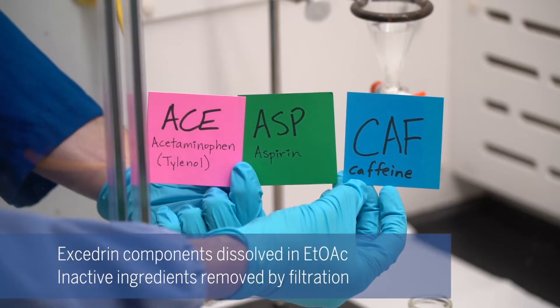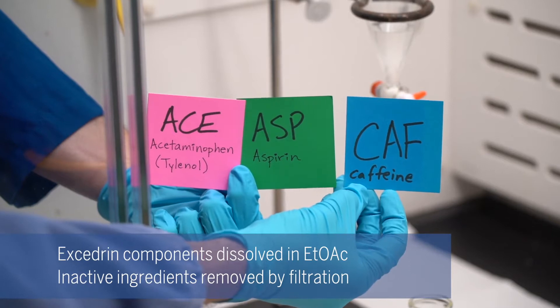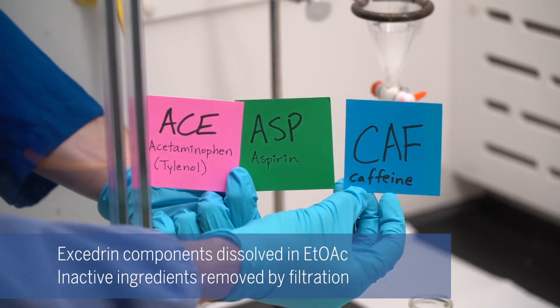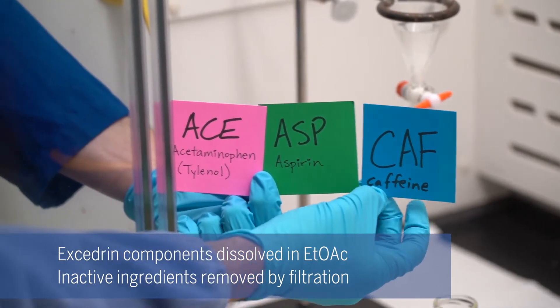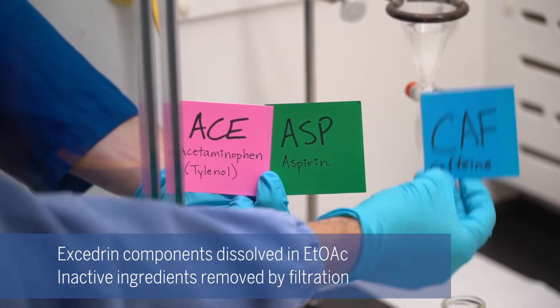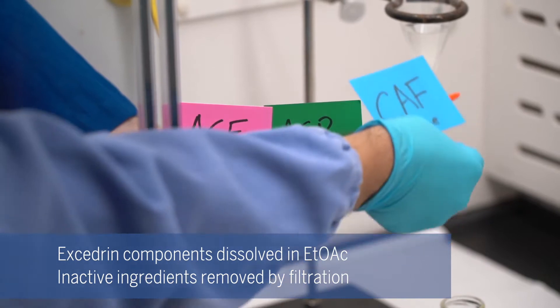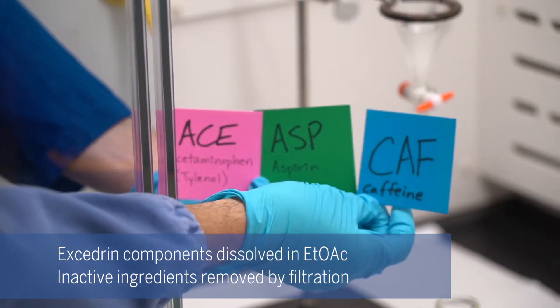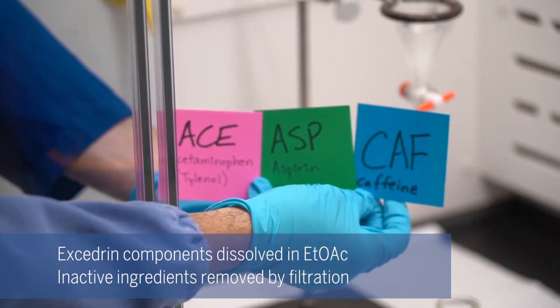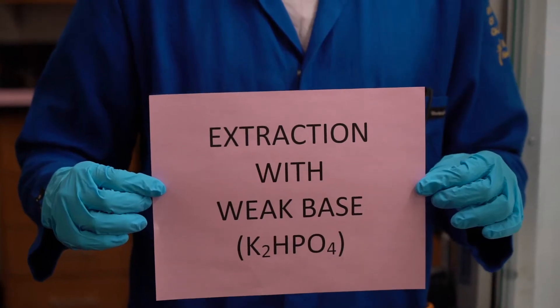Excedrin is composed of acetaminophen, aspirin, and caffeine. Now that all three of these are mixed into one solution, we're going to go ahead and start separating them.